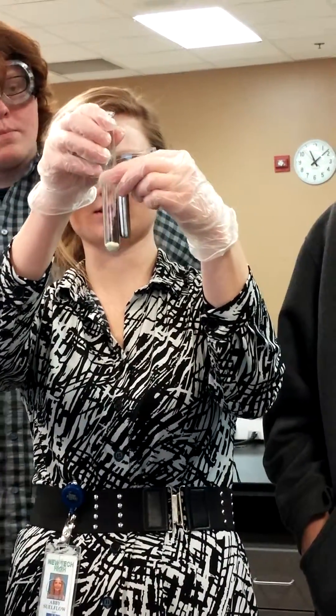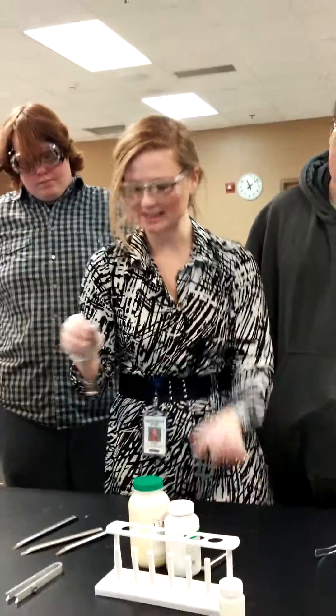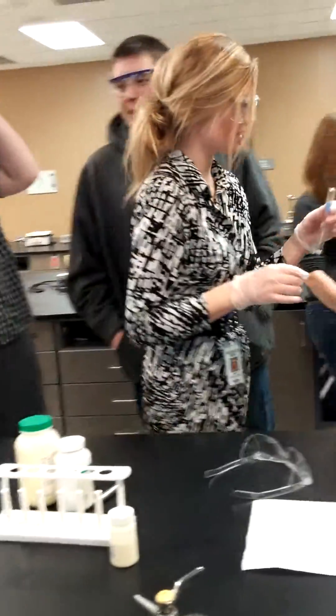You mean like those etch-a-sketches? Well, no, not etch-a-sketches. Okay, so let's heat it up. No, it should work.